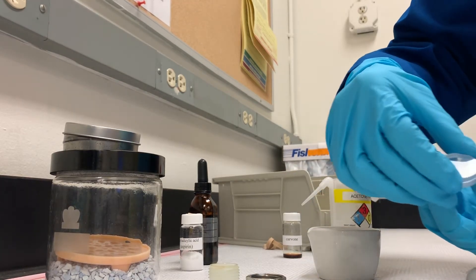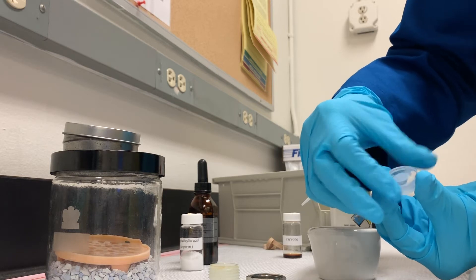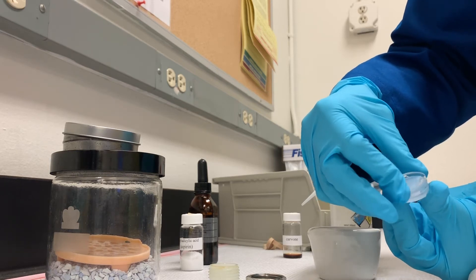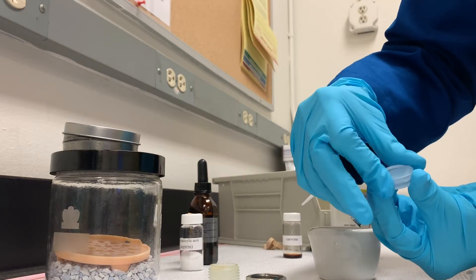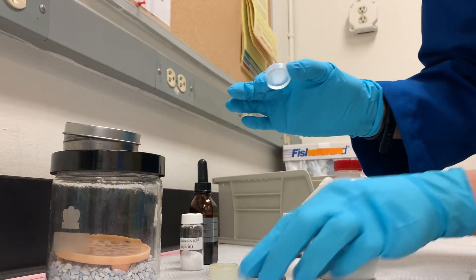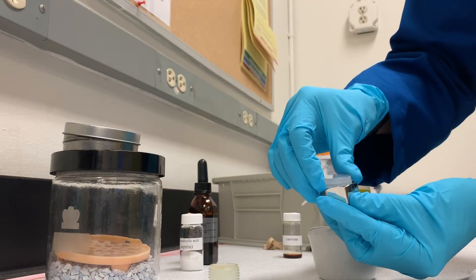I'm going to put these on here. I twist to try and get some even coating on there. So again, if it's too much sample, the IR rays will just be deflected. And put this in my sample holder carefully. Ta-da!